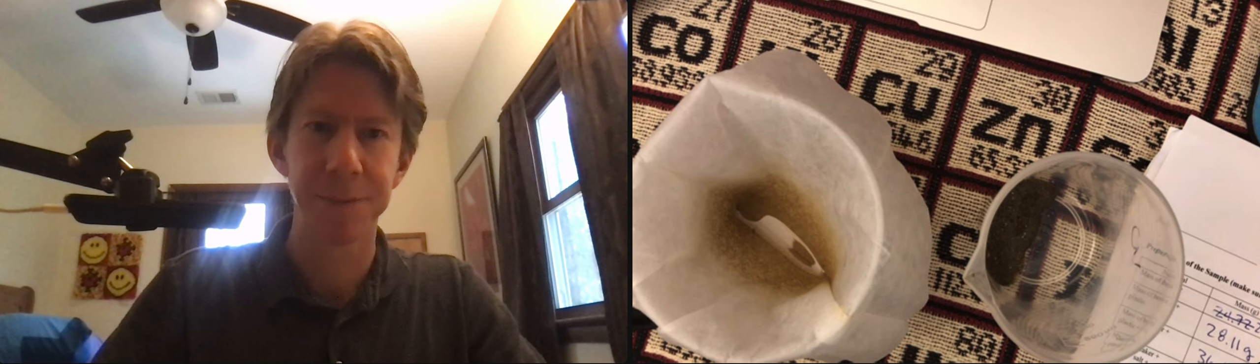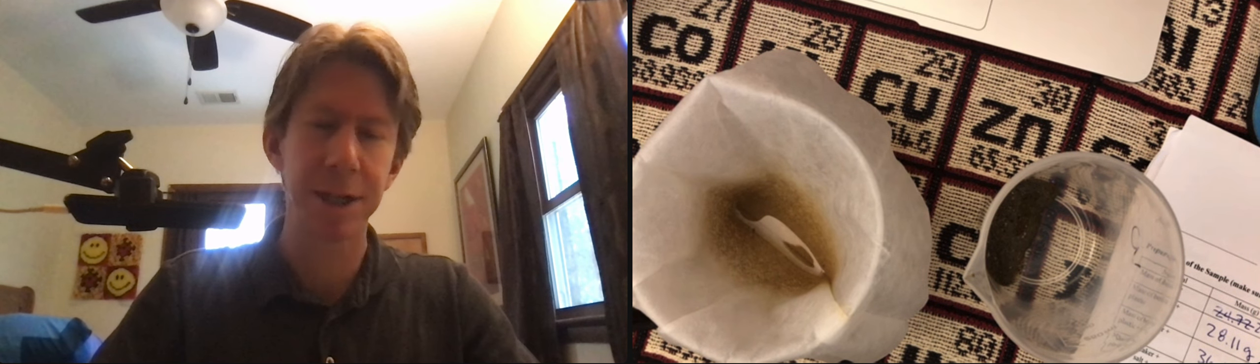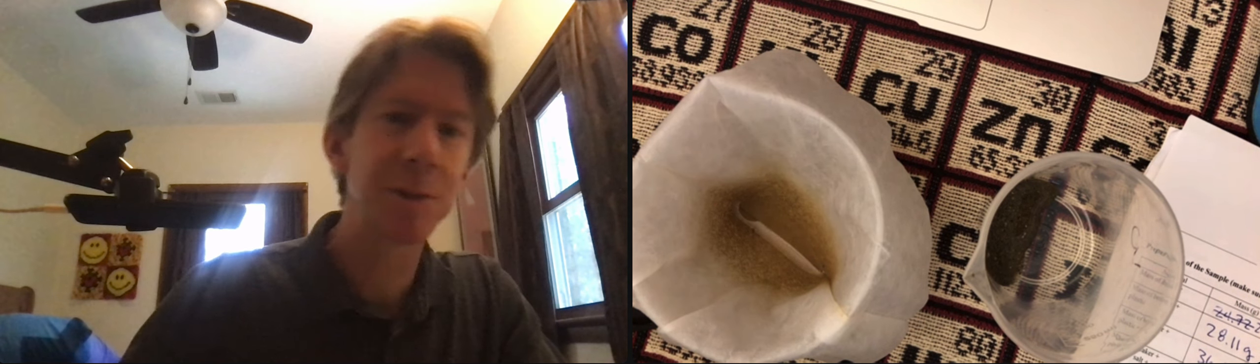Looks like there's just a little bit of solution left. So we've drained most of it. We'll have more time for it to drain later. Let's pick up where we left off.